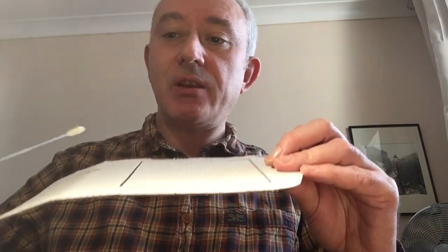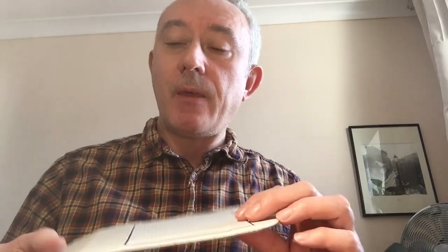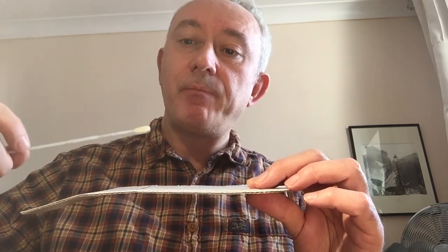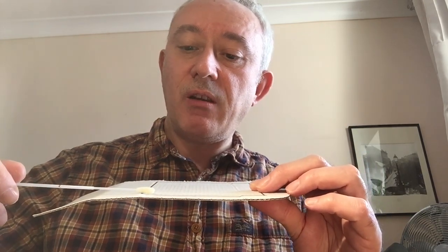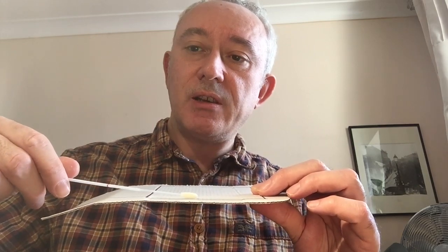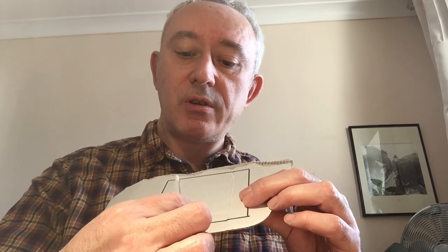What I'm going to illustrate is the importance of technique. I've drawn out my surface area with a marker pen. The important technique with a swab is always to do a gentle rolling action — you need to expose all sides of the swab tip. The swab rolls down the surface being lightly rotated, then up whilst rotating, then down again rotating. After that, you go in the across direction, rolling lightly across and again rolling lightly across.